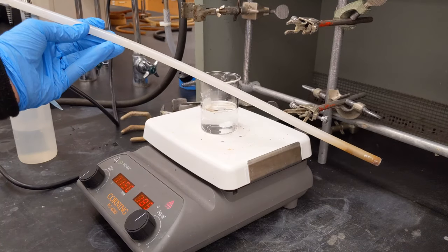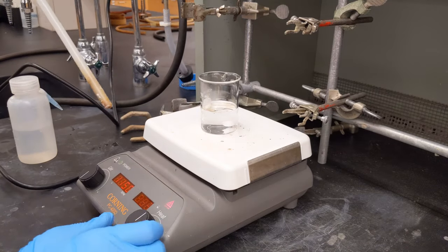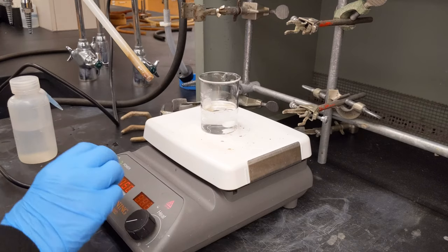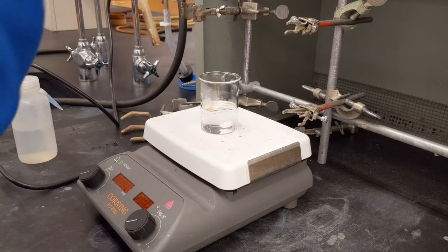Once I'm all done using this, I need to remove my magnetic stir bar. I need to turn off the heat, turn off the stir function.